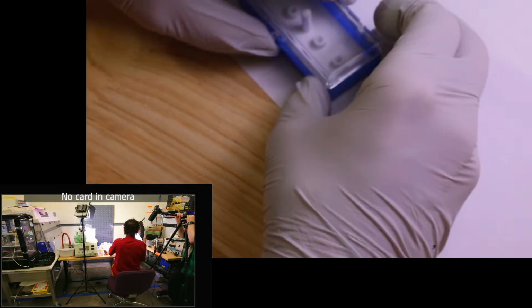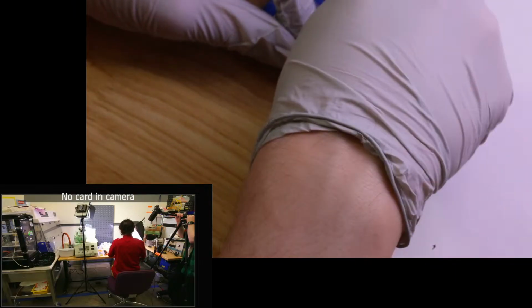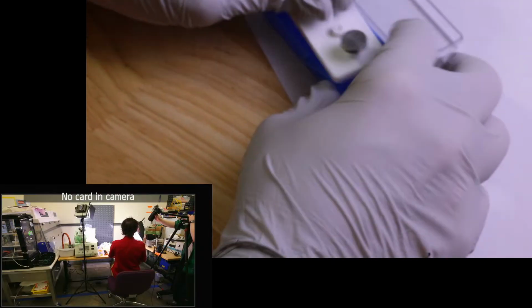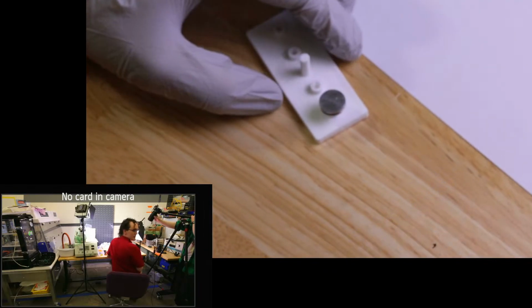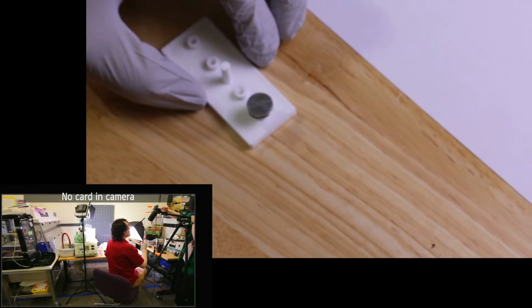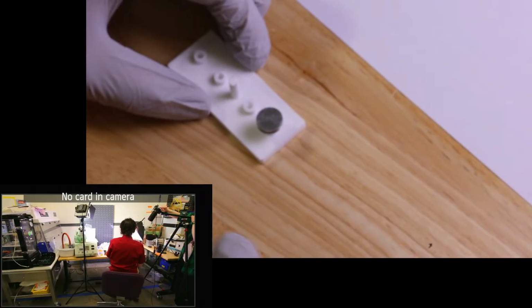Okay, so let's get a stub out. We'll get a stub in a box here. Does this have zoom? It does not have zoom. Okay. Fixed focal length. All right. And then I'll just go and put it in autofocus. Yeah, it's easier. So there's our stub.